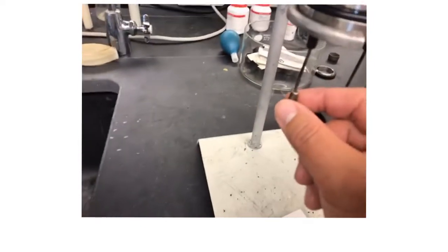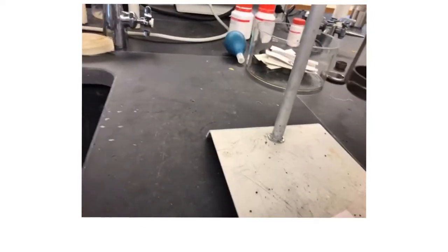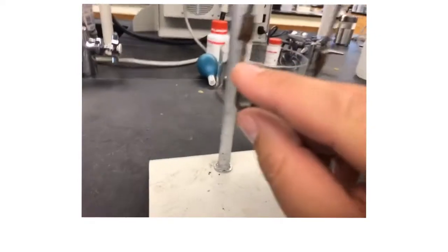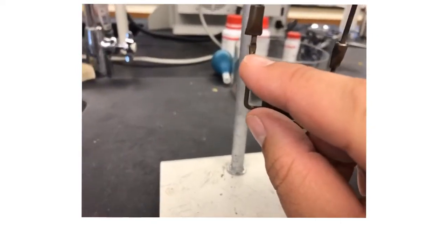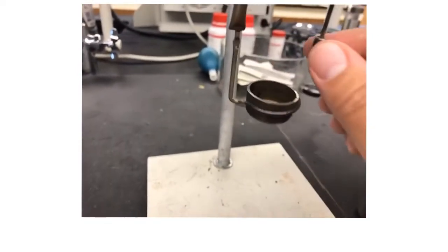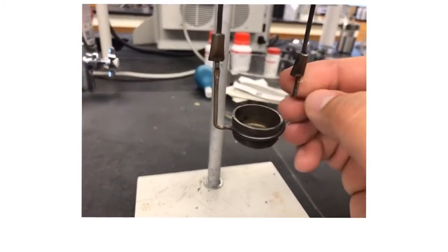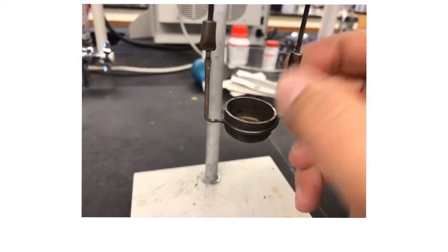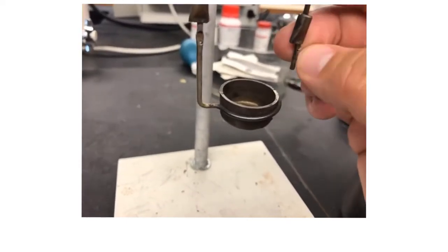These little guys here, these little pieces pull up. There's actually a little hole where the wire goes through. There's another one on the opposite side. You can usually see the pieces of the wire from the previous experiment left over that you can remove and get rid of.